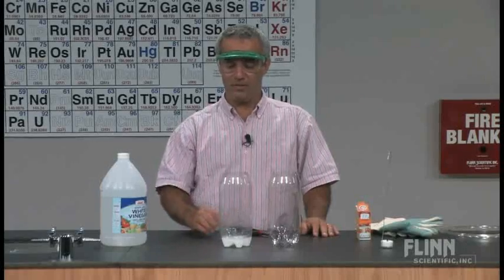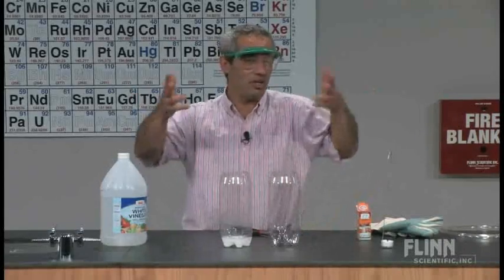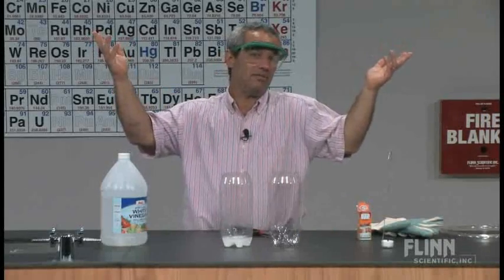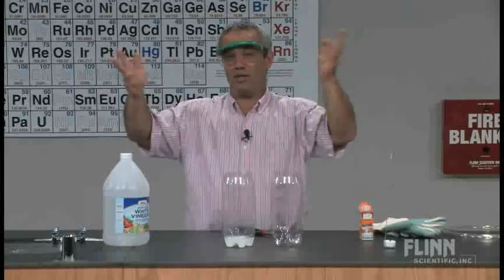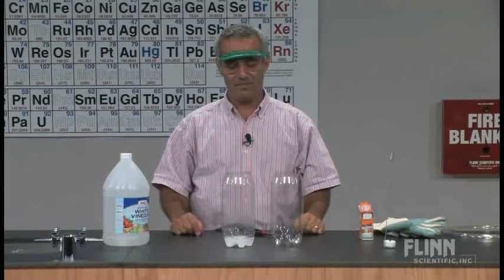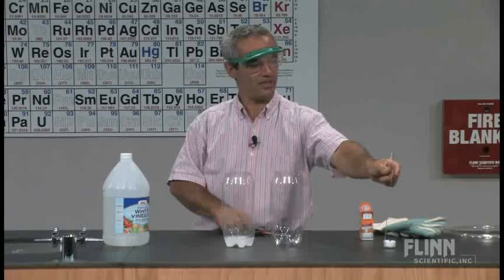And the bubbles of it form and where do you suppose that carbon dioxide is by now? Out in the room? You might think so, especially if I do this with my hands, but turns out it's not. We're going to find that out in a second.